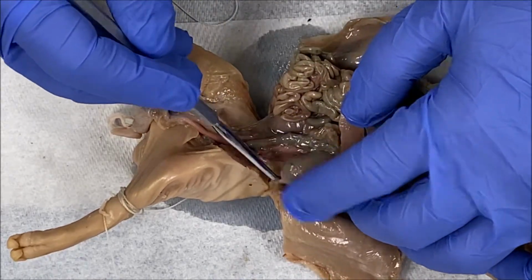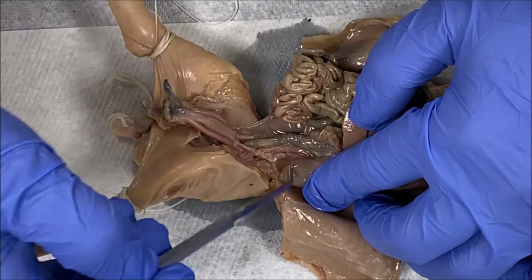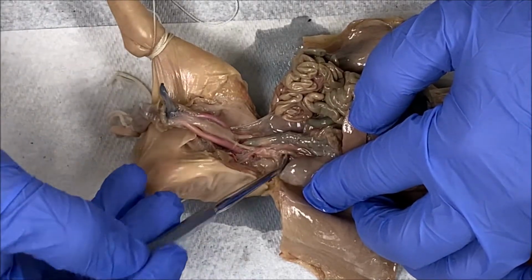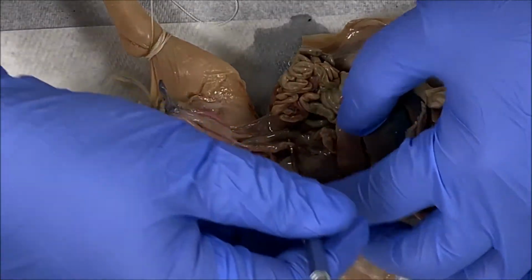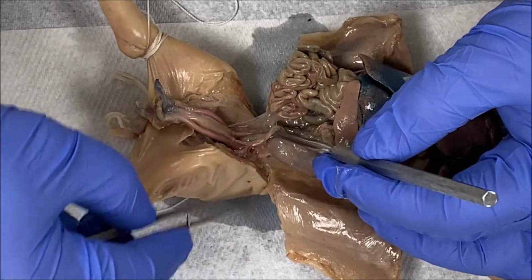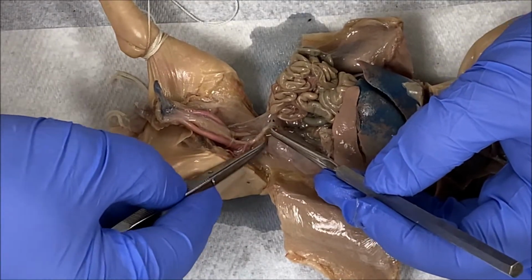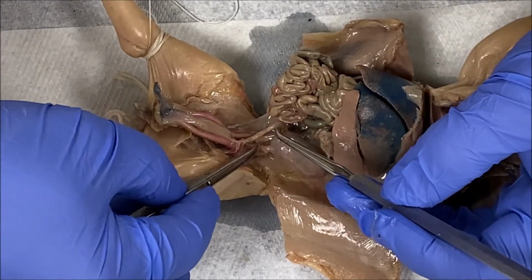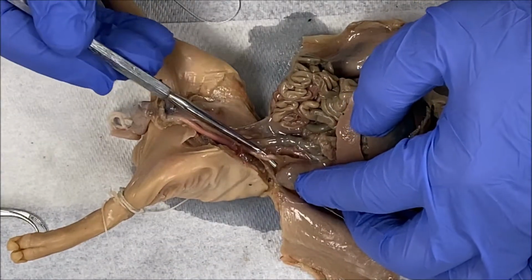Coming off of the kidney, or exiting the kidney at the hilum, is this right here called the ureter. So again, I'm going to take some time and loosen the connective tissue surrounding the ureter so I can see it. I may have to use two hands, one using the forceps and the other using the seeker probe. I'm carefully pulling away the connective tissue until I clearly see the ureter. Okay, so there's the ureter.